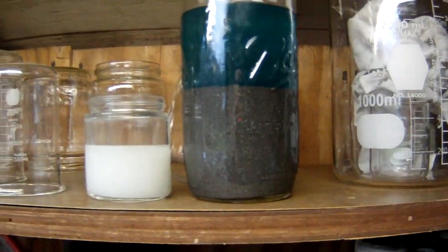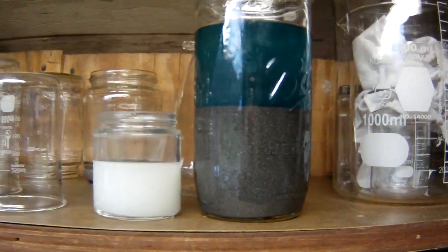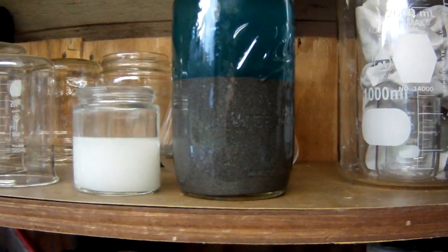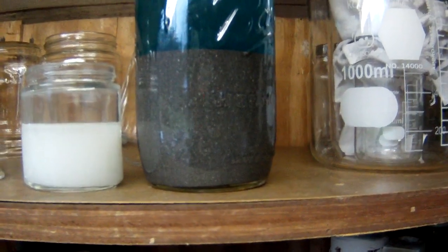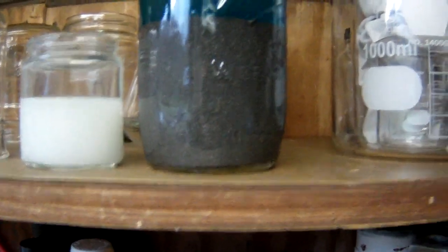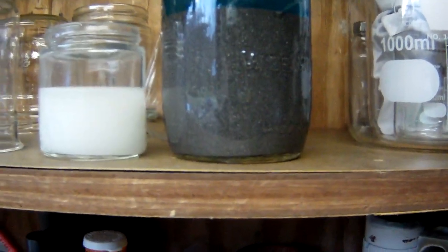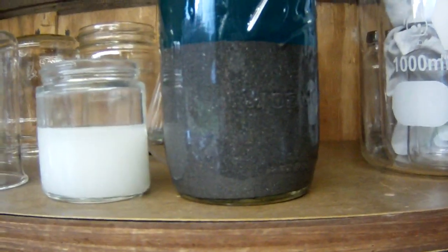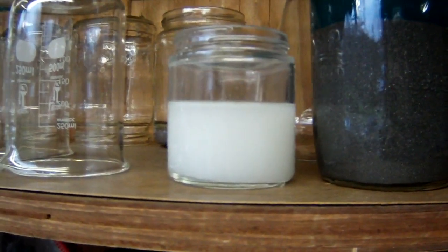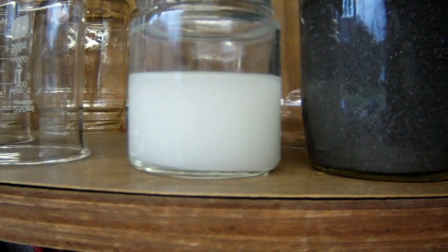Okay guys, I just wanted to give you a quick look at this again, because as it stands, I have no idea what that is. I've never seen that happen before. I mean, it literally looks like when you try to precipitate palladium with zinc. It's very light, it's very fluffy. If I move it, all of it moves. It's not like silver. I mean, I can see silver in it, but what the rest of that is, I have no idea. I took a little of the rinse water here and put some HCl in it to see, and it definitely has silver in it. So I'm going to let that settle out.